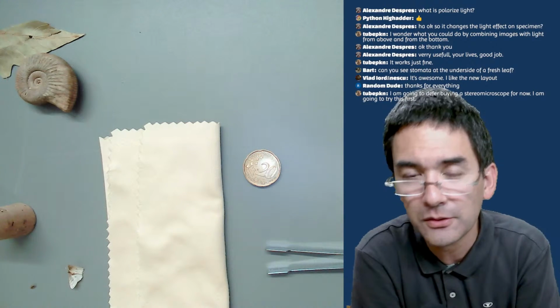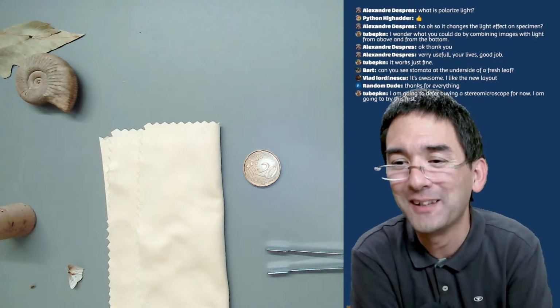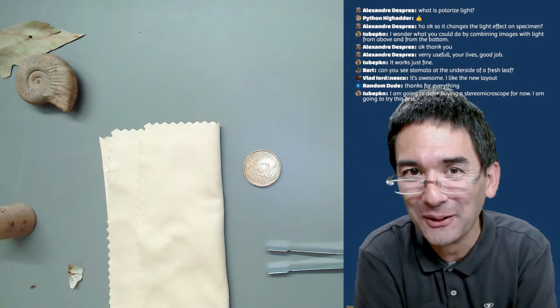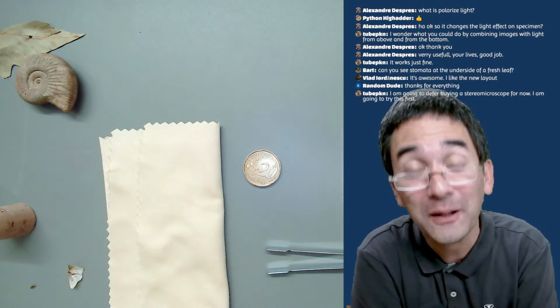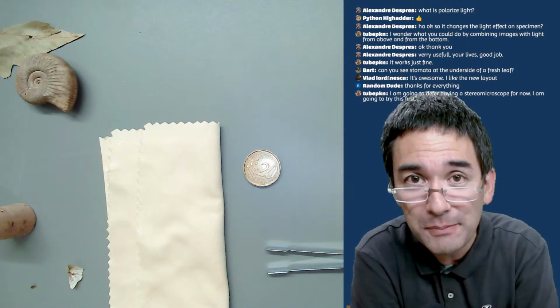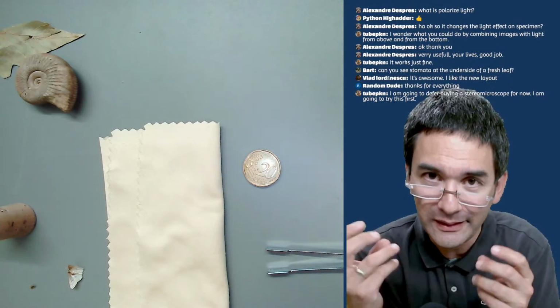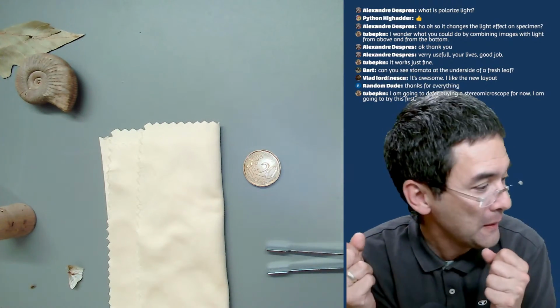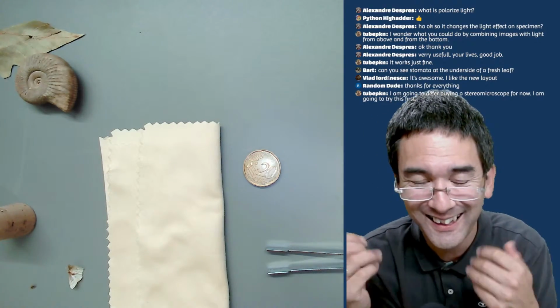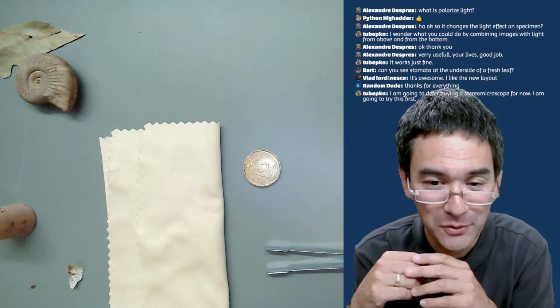So I'm going to defer buying a stereo microscope for now. I'm going to try this first. I think that's actually one of the reasons to get yourself a stereo microscope in any case, because simply seeing things stereoscopically is already quite impressive. But this also works pretty well, and for this reason, I just wanted to share this with you as well.